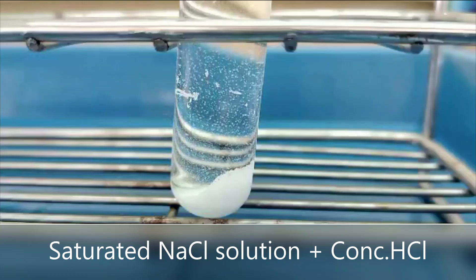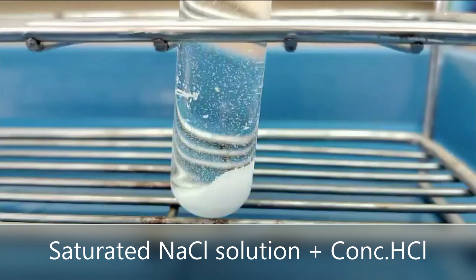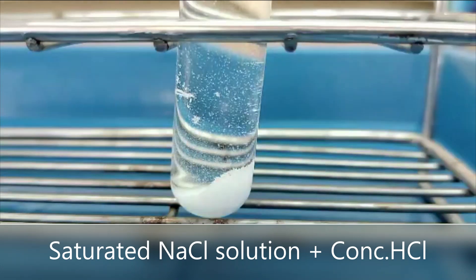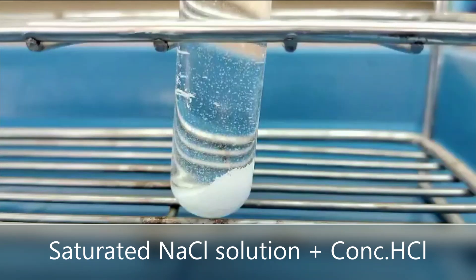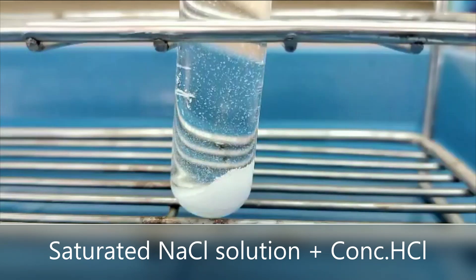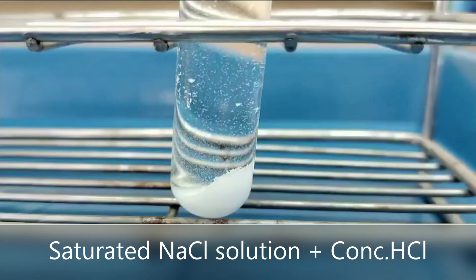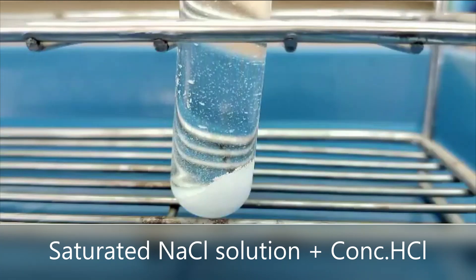Therefore, when adding hydrochloric acid at 12 molar concentration, it will increase the chloride ion content in the system, disturbing the chemical balance of the reaction. It increases the concentration of the reactants, causing the solubility equilibrium constant of sodium ions and chloride ions to be greater than the solubility equilibrium constant of sodium chloride. Crystallization of sodium chloride is formed.